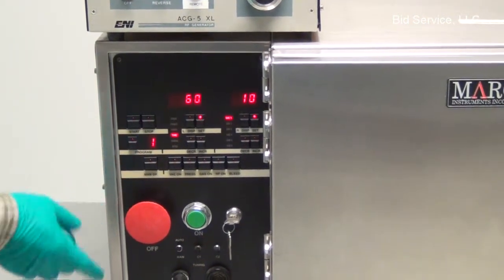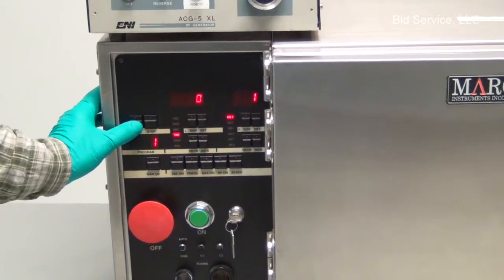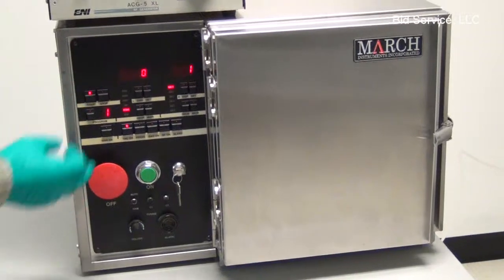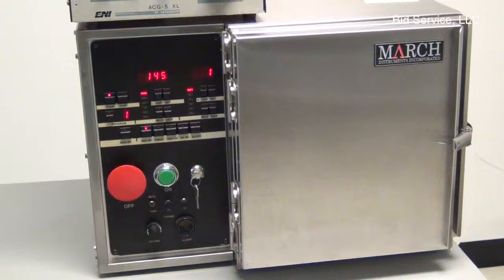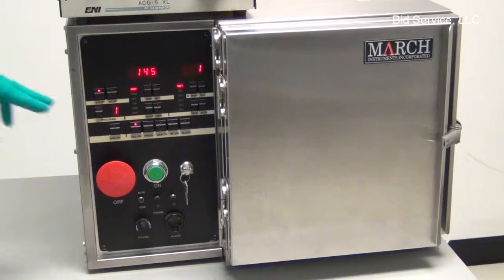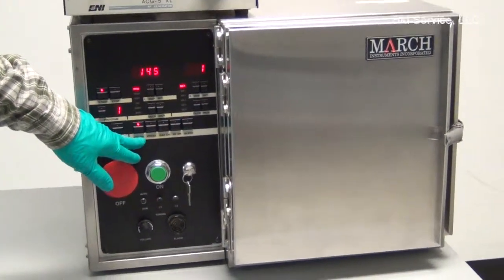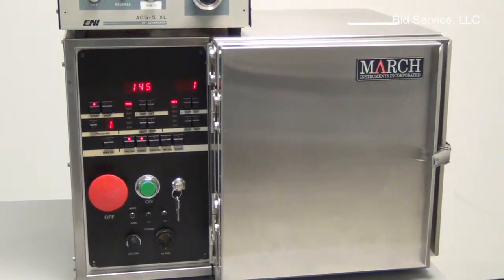So what we'll see here is I'm going to start it at 1. Hit start. At this point the vacuum turns on, and by hitting the display here you can look at different things that are occurring in the program. We're going to look at the pressure. Right now the baratron is isolated from the vacuum chamber, so there's an internal timer that's going to count down for approximately 45 seconds to a minute. And it'll switch over, open up the valve to the baratron, and it'll monitor the pressure in the system.